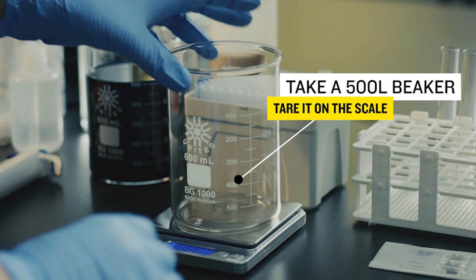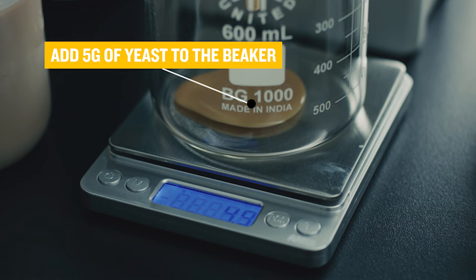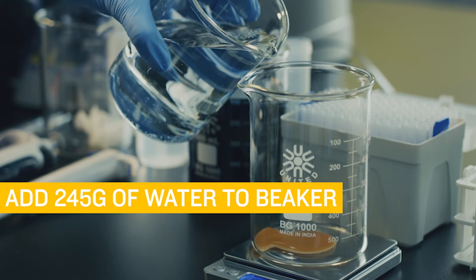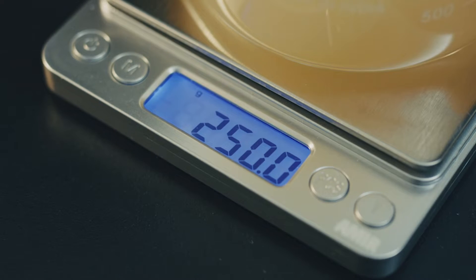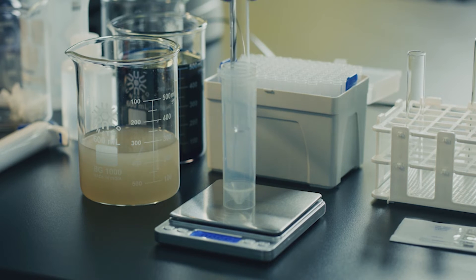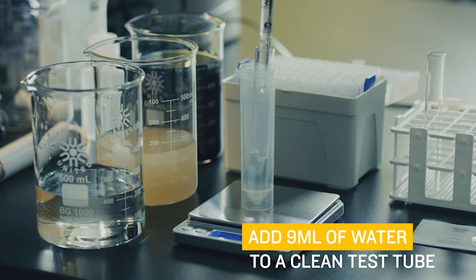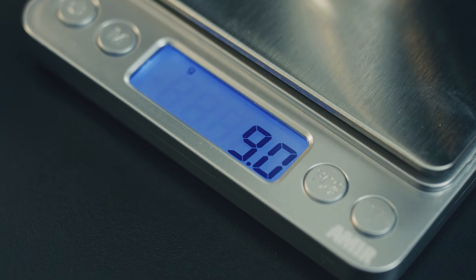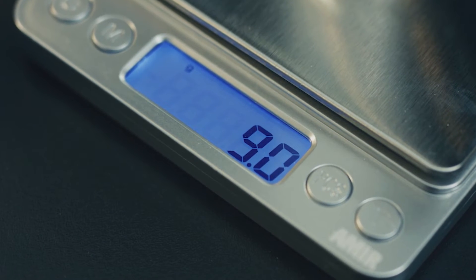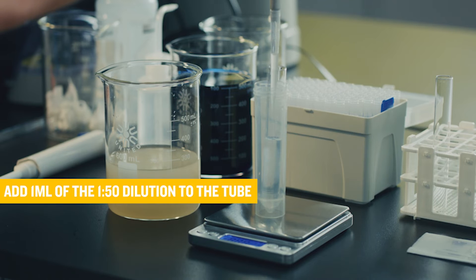Here are the steps to make a 1 to 1,000 dilution. First, take a 500 milliliter beaker and tare it on the scale. Next, add 5 grams of yeast to the beaker. Then add 245 grams of water to the beaker — you have now created a 1 to 50 dilution. Grab a test tube for the next step and add 9 milliliters of water to a clean test tube. Make sure you are measuring from the bottom of the meniscus when using a pipette. You can double check you have the correct amount by weighing the expelled material — 1 milliliter equals 1 gram, so 9 milliliters of water will weigh 9 grams. Then add 1 milliliter of the 1 to 50 dilution to the tube. You have now created a 1 to 500 dilution.